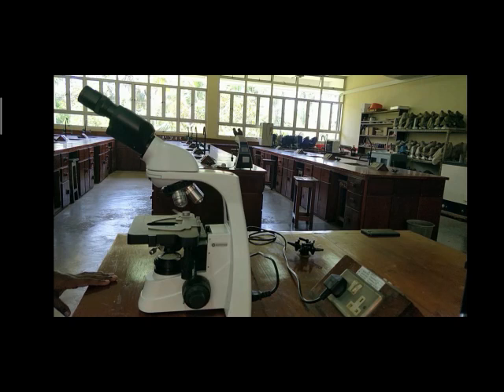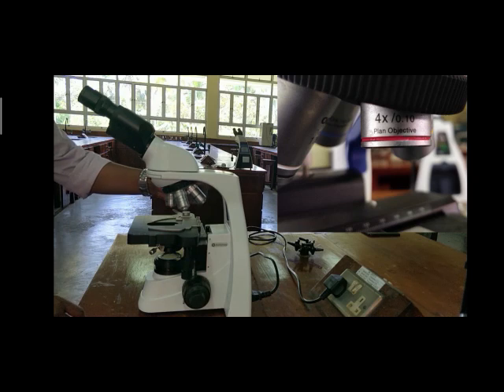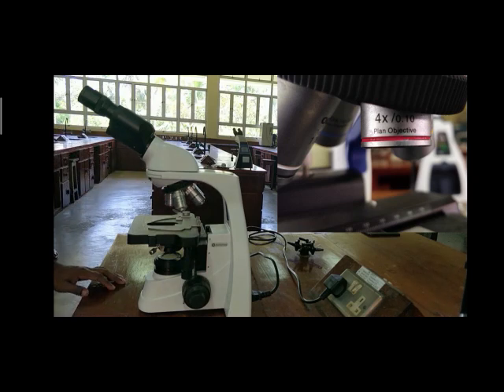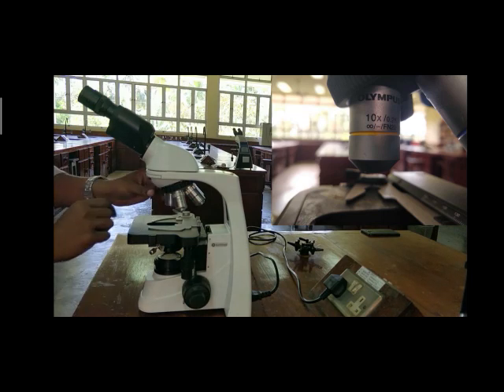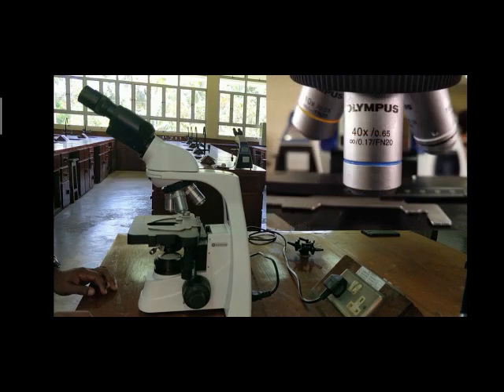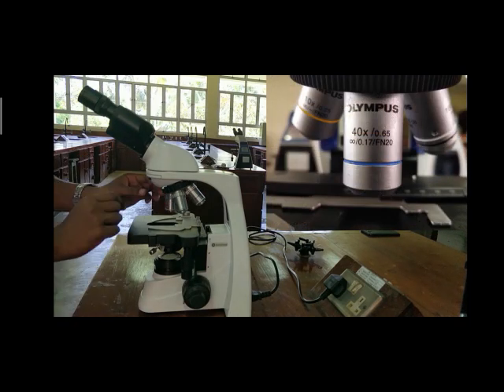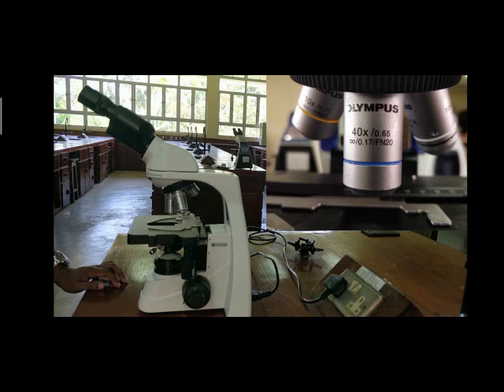So there are four objectives. The first one is the magnification of 4 times for the identification of most of the arthropods. Then the low power magnification of 10 times for the identification of helminthic eggs. The high power magnification of 40 times for identification of protozoan cysts and for confirmation of helminthic eggs and for identification of a perfect area to look for malarial parasites.